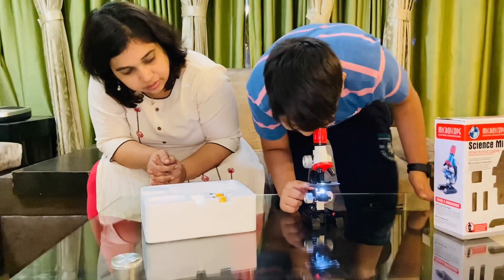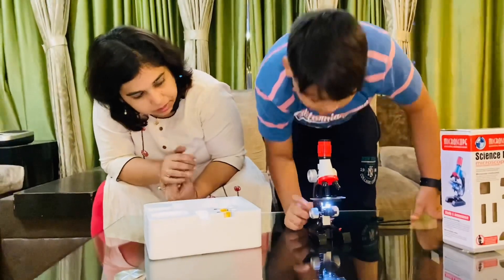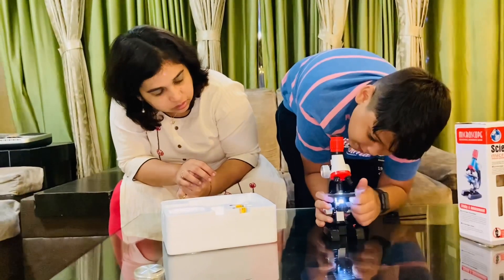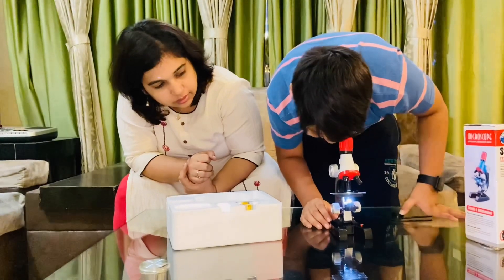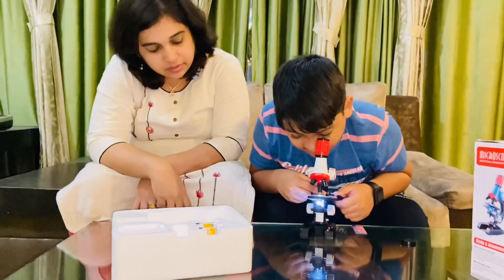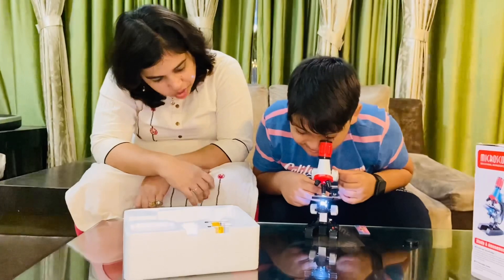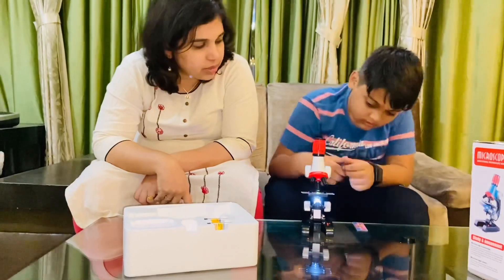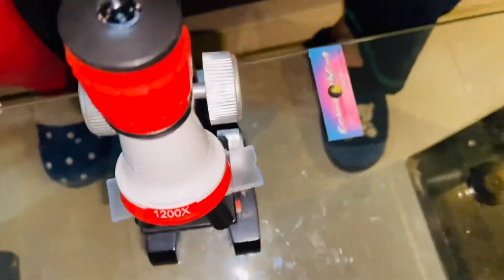Do you see something? It looks the same — like crushed ice? Yes, but how about the green part? I don't see the green part. Maybe I need to adjust it. Actually, it kind of looks like a thread — lots of threads. So it is similar to onion but these are very thin lines and there is no structure. Onion had an ice-cube kind of structure, but there is no clear structure for this gel.